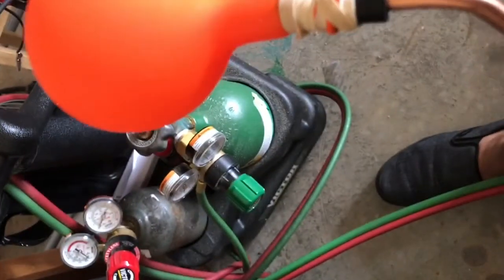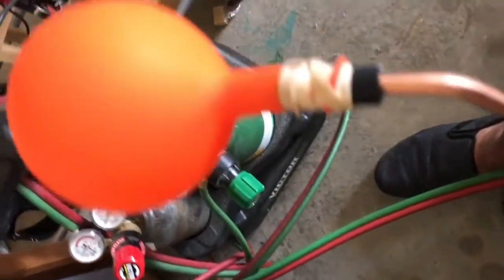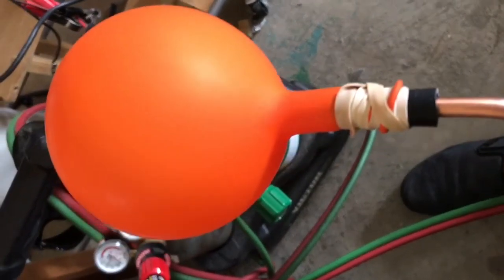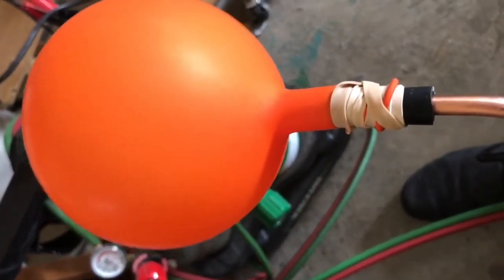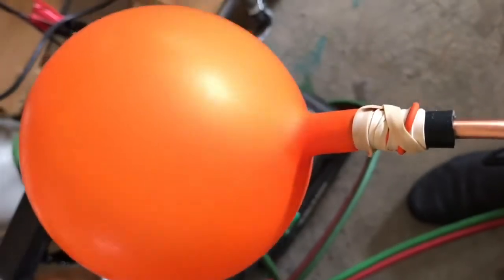In this clip, I'm filling a balloon with oxygen from an oxyacetylene tank setup to demonstrate the magnetic properties of frozen or liquid oxygen.